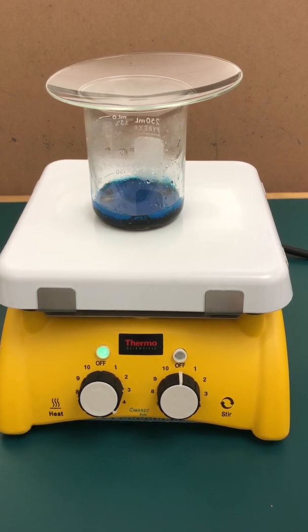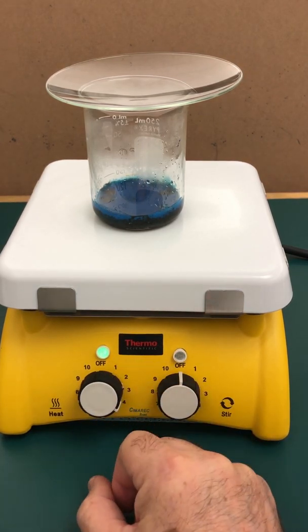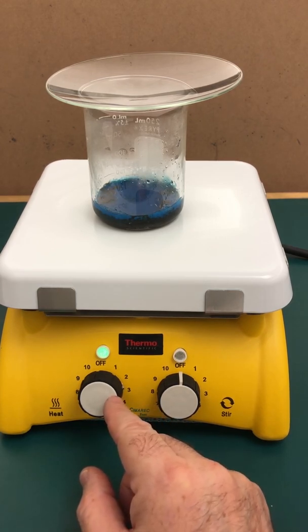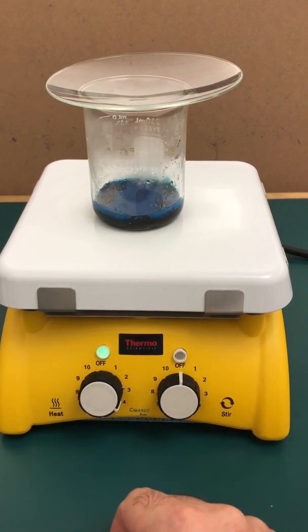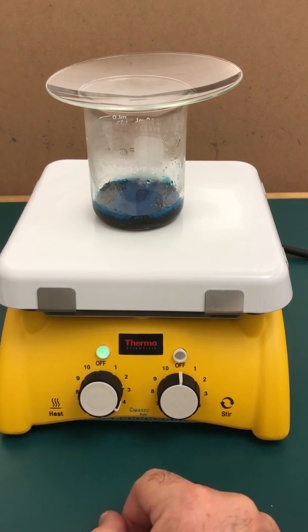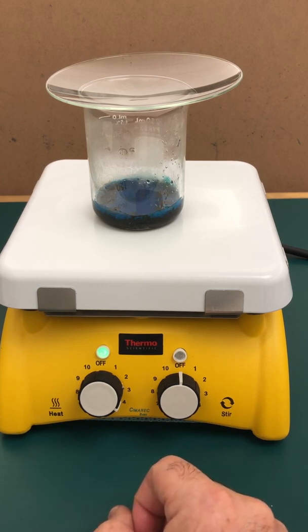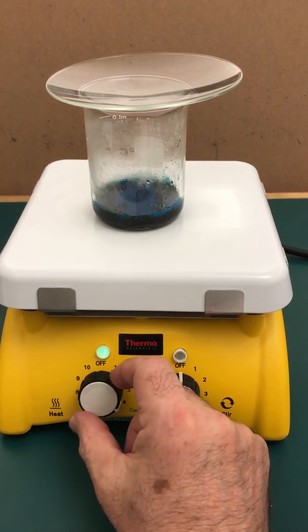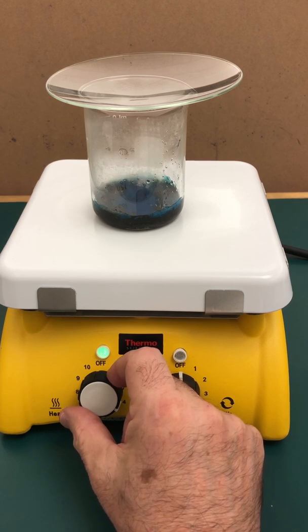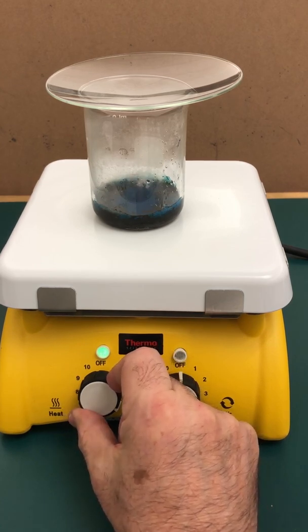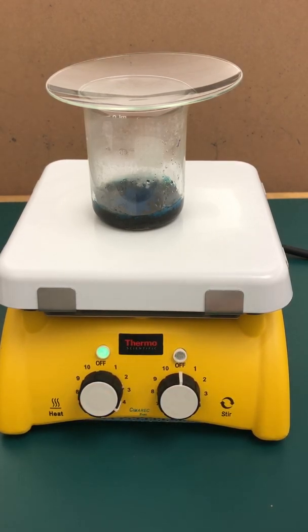At this point, the mixture has started to boil. So I turned the heat down here to the lower region of the control. The other thing you can observe is that the mixture inside the beaker is getting darker and darker. This is the copper two oxide product, which has a dark color in comparison to the other copper two containing compounds that have the bright blue. Notice that there's minimal bubbling, minimal jumping. I want to make sure there's no splattering. This only takes about a minute or so before it starts. You can see how it's all turning dark color.